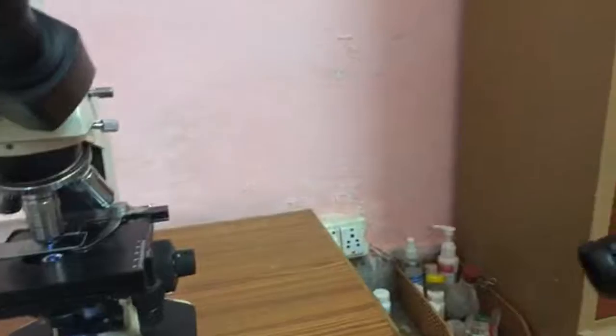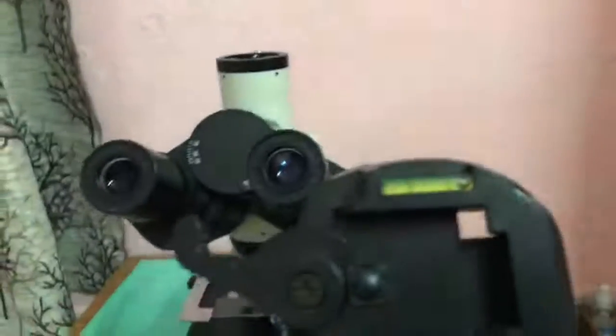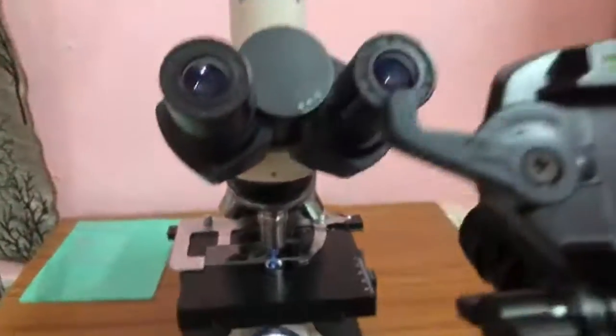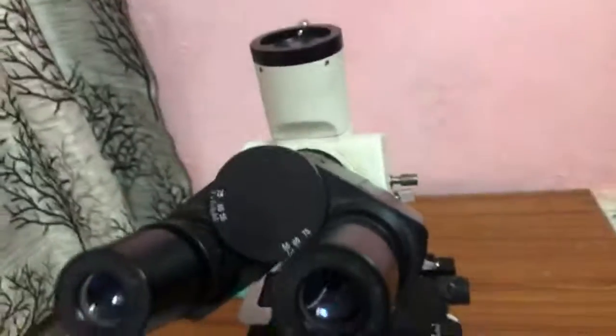And when I observed it, I found a lot of ciliates in this. There are some few organisms also, but then primarily there were ciliates, and I focused on one particular part of the slide, the corner, wherein the ciliates were plenty. Now there are a few ciliates who are in the phase of reproduction, so I thought it would be fascinating to watch them separate.